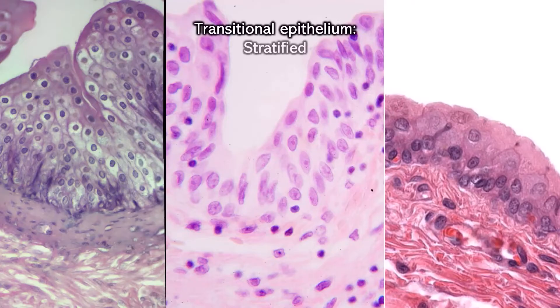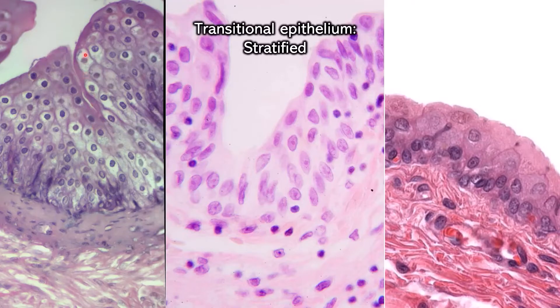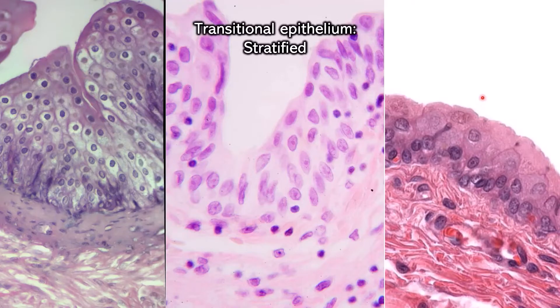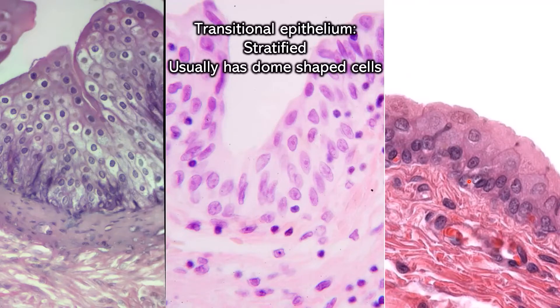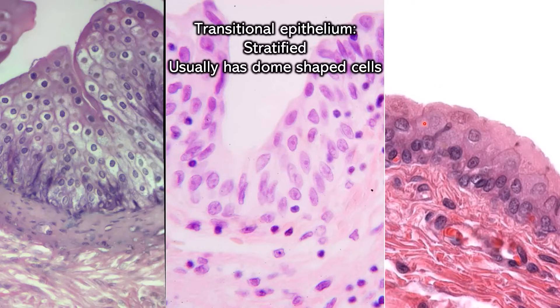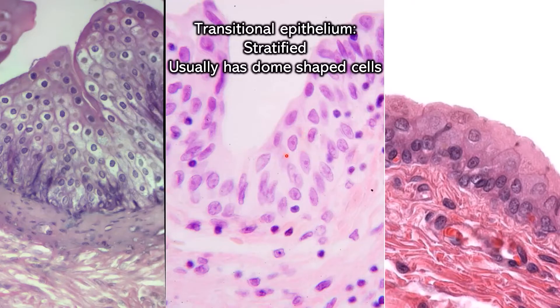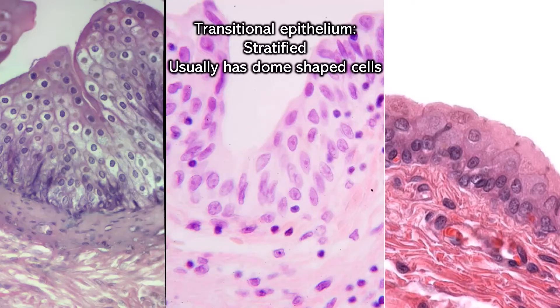All transitional epithelium is stratified, so that's what you want to look for first. All three of these examples have multiple rows of cells, and usually there are dome-shaped cells — ones that are kind of bubbly — especially near the top, although not always, as we can see in the second example. Some of the cells are dome-shaped, but the dome isn't necessarily near the top.